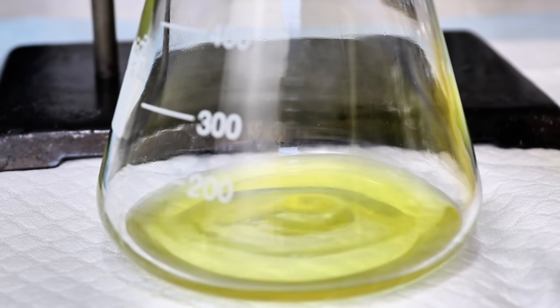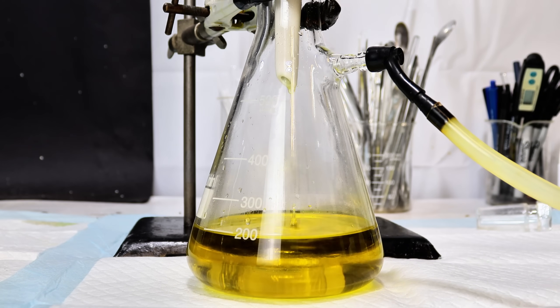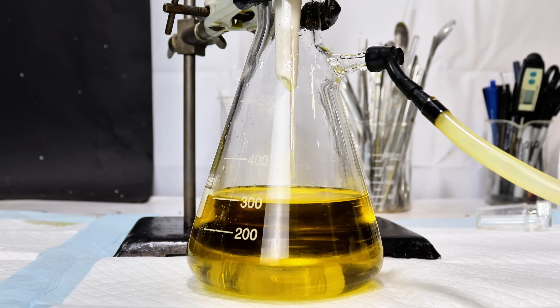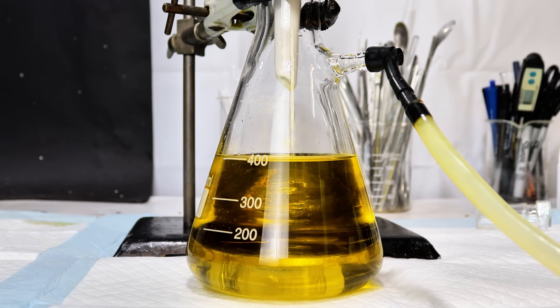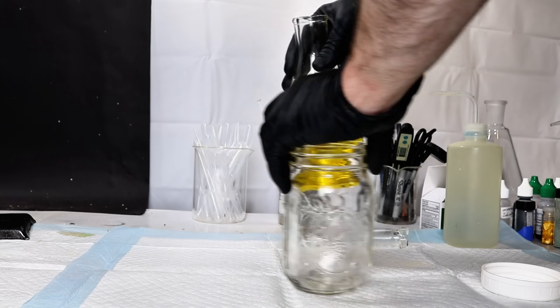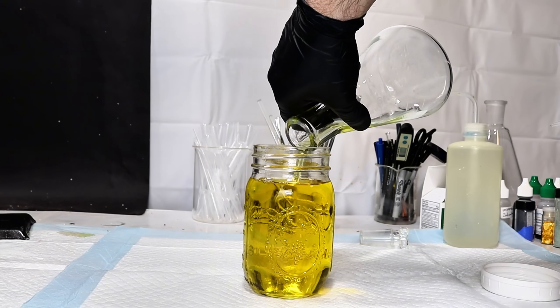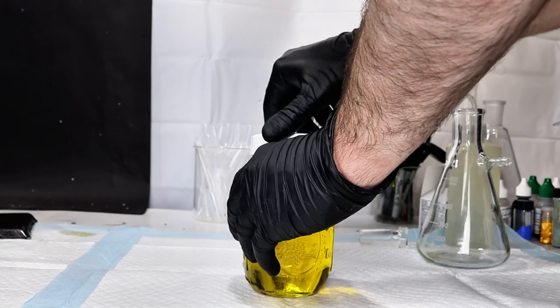This was then passed through my Buchner funnel one final time, leaving me with a pure and dry biodiesel. I forgot to weigh my final yield, but as you can see here, I produced just enough to perfectly fill up this 16-ounce mason jar.